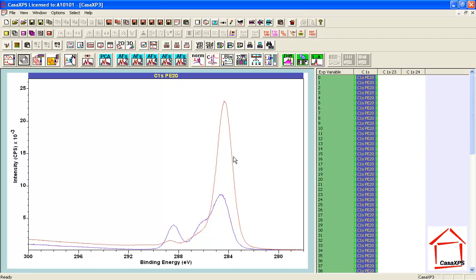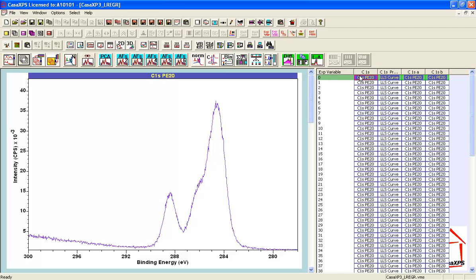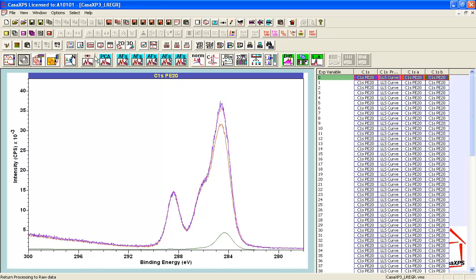And to test whether these work for all the data, I'm going to do a least squares analysis, meaning I'm going to fit these component spectra to these carbon 1s spectra that are selected. So I press the button, it tells me that I've got target spectra of 90 and my basis spectra, there are two. The two come from the active tile, the 90 come from the selected, and I say yes. And then the fit has occurred, and I can then look at how well the fit has progressed. Well, now it's not entirely perfect here, but this looks reasonably good across most of the spectral range.